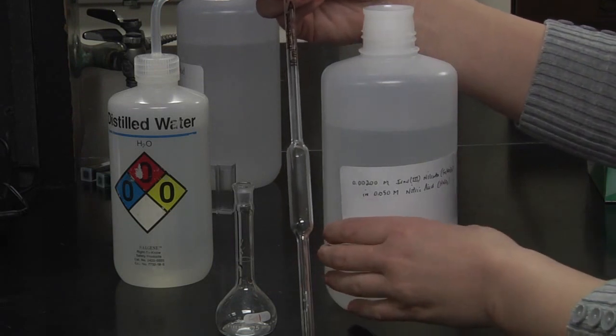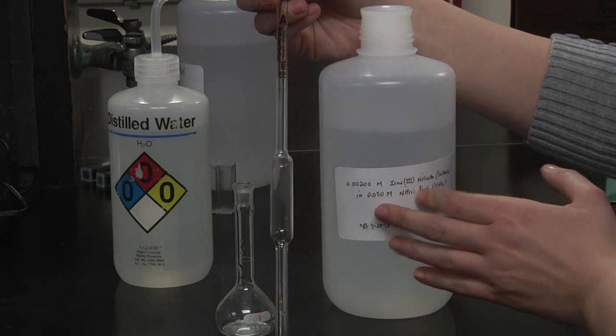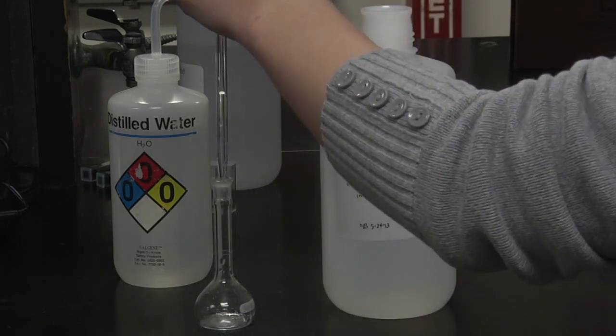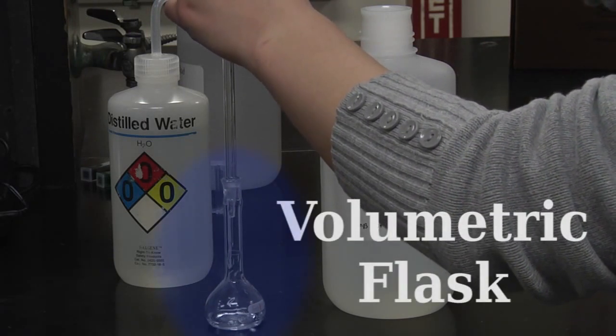Then put that into your 25 milliliter volumetric flask.